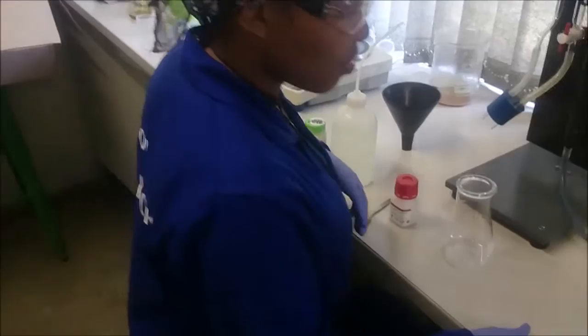Introducing Brenda and Thule. Superstars. Right, this is the calcium hydride water test. This is Brenda and we're going to go through the calcium hydride test today.